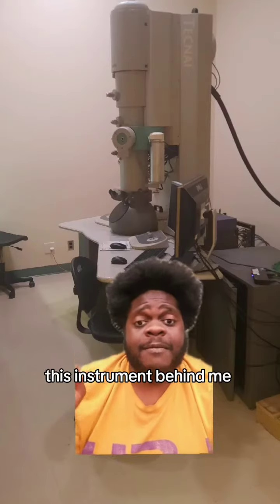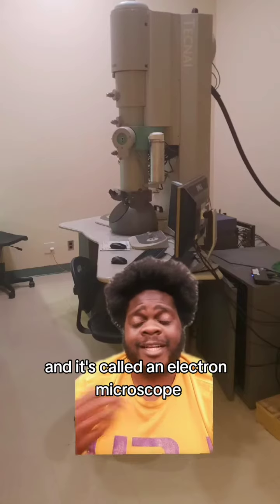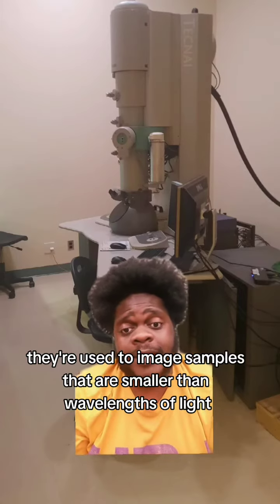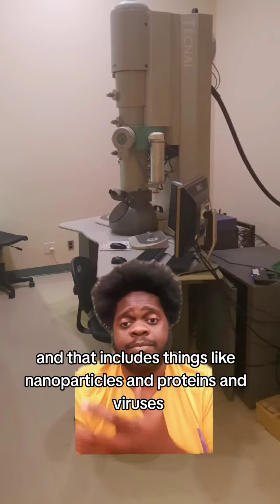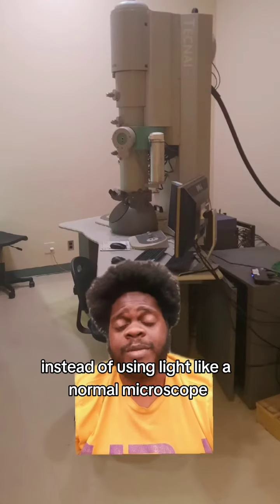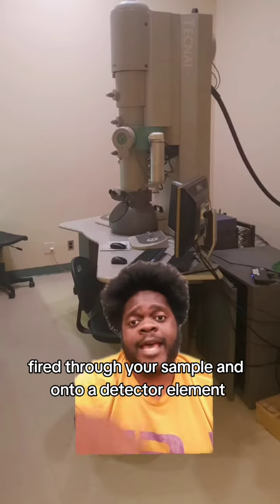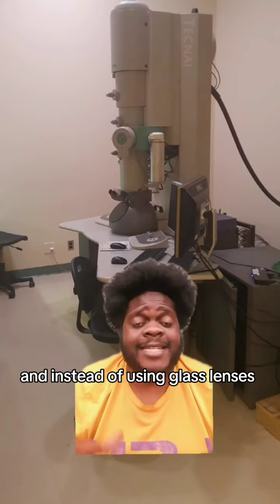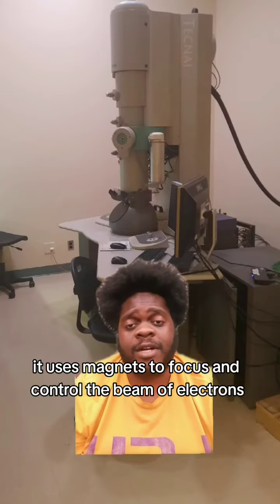This instrument behind me is probably one of the coolest instruments I've ever used, and it's called an electron microscope. They're used to image samples that are smaller than wavelengths of light, and that includes things like nanoparticles and proteins and viruses. Instead of using light like a normal microscope, it uses a beam of electrons fired through your sample and onto a detector element. And instead of using glass lenses, it uses magnets to focus and control the beam of electrons.